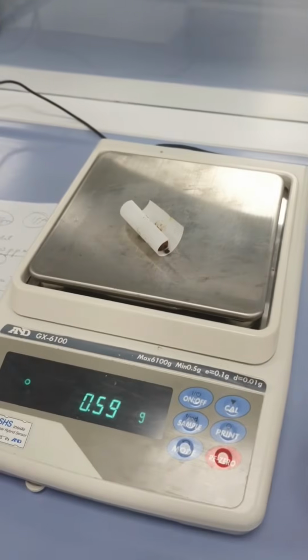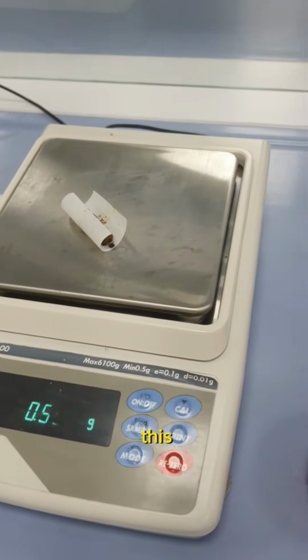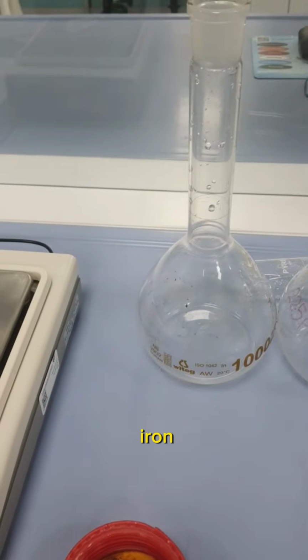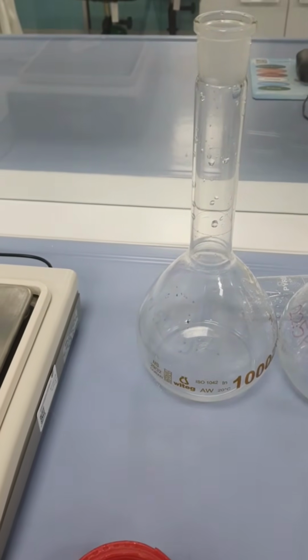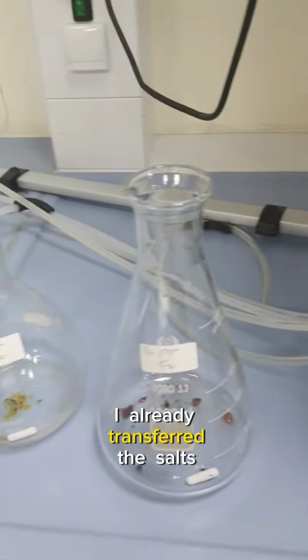Now I have weighed around 0.58 gram of the iron chloride salt. So now I will transfer this to prepare 200 ppm of the iron. Now we are done with the measurement. I already transferred the salts.